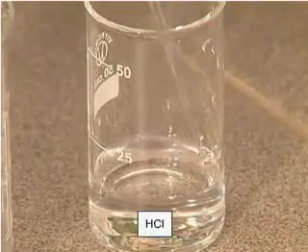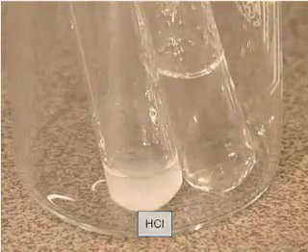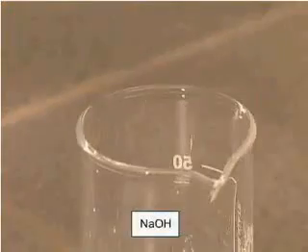We add a solution of hydrochloric acid to one portion, and sodium hydroxide solution to the other portion.